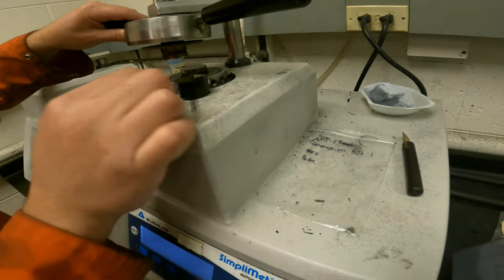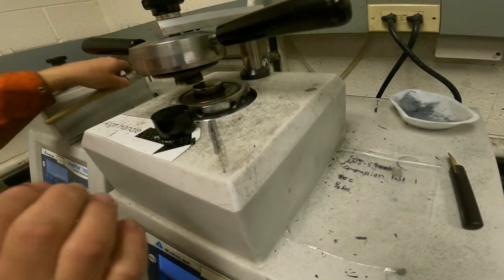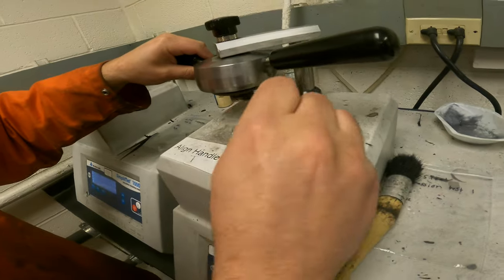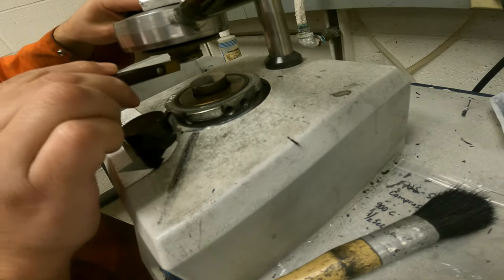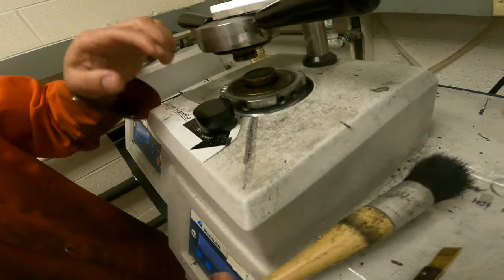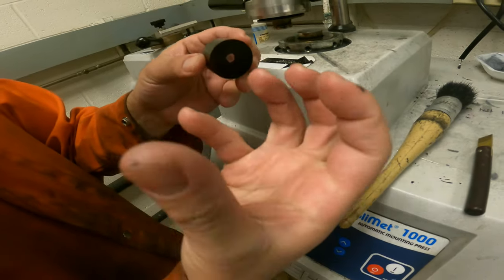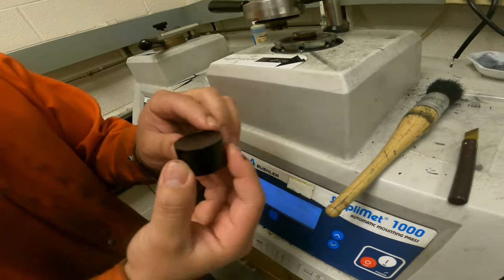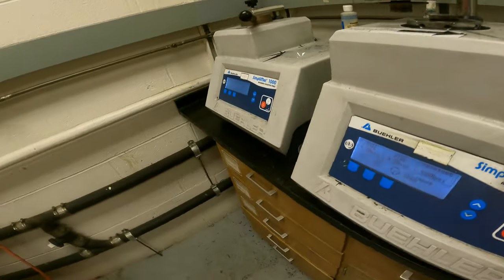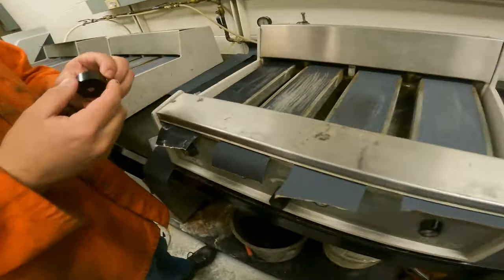You see it's a little dirty, so that's the part you need to clean. Make sure we use a brush to clean and also the blade to remove all the sticky parts here before starting the next process. The other thing you notice is there are some sharp edges. They're annoying, especially for your hands. They can scratch you. So usually what I do is remove them manually with sandpaper.